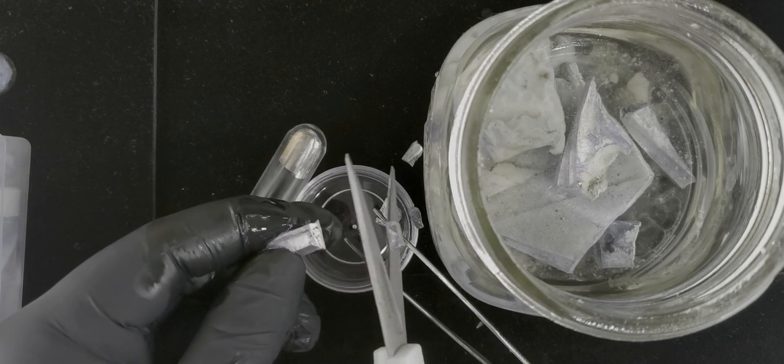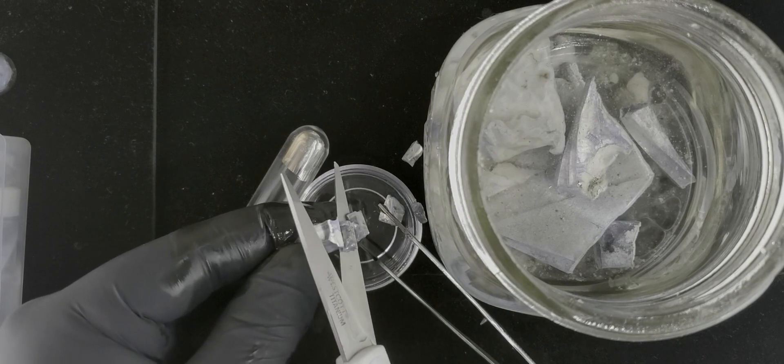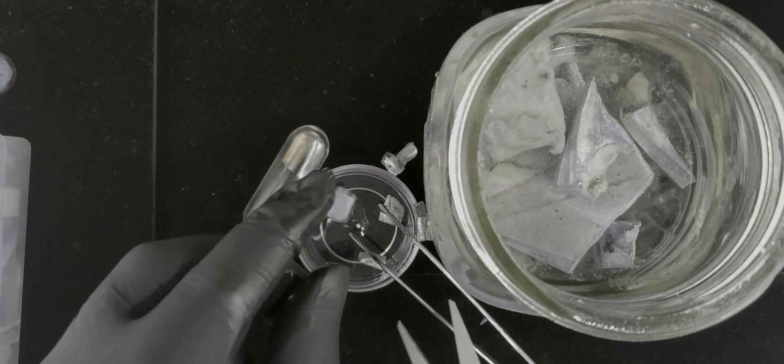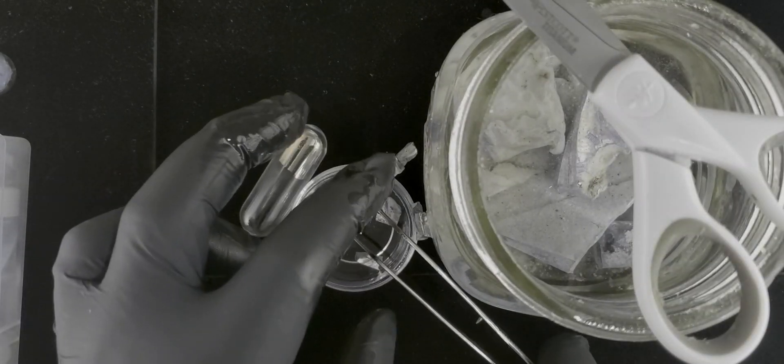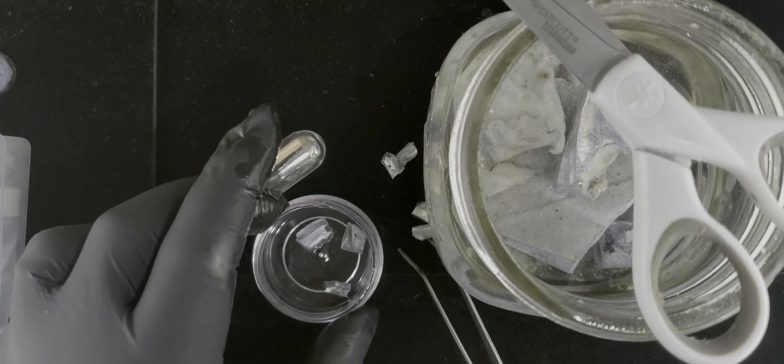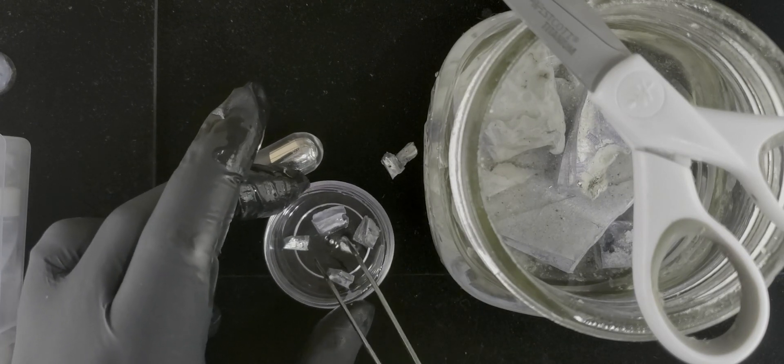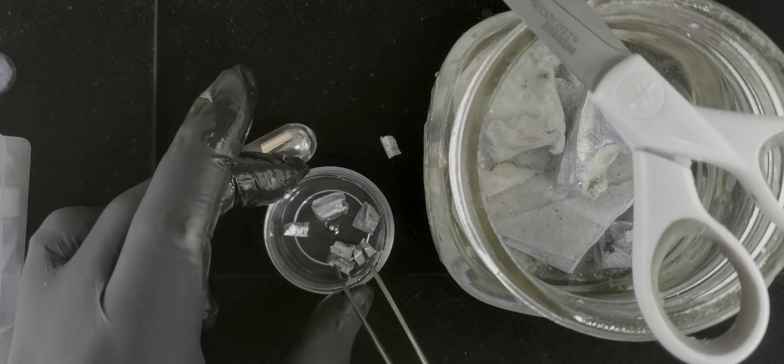If we try to dry it, that oxidation layer comes on so fast. It's like literally before your eyes. It's not going to cooperate here because the scissors itself is kind of oily.